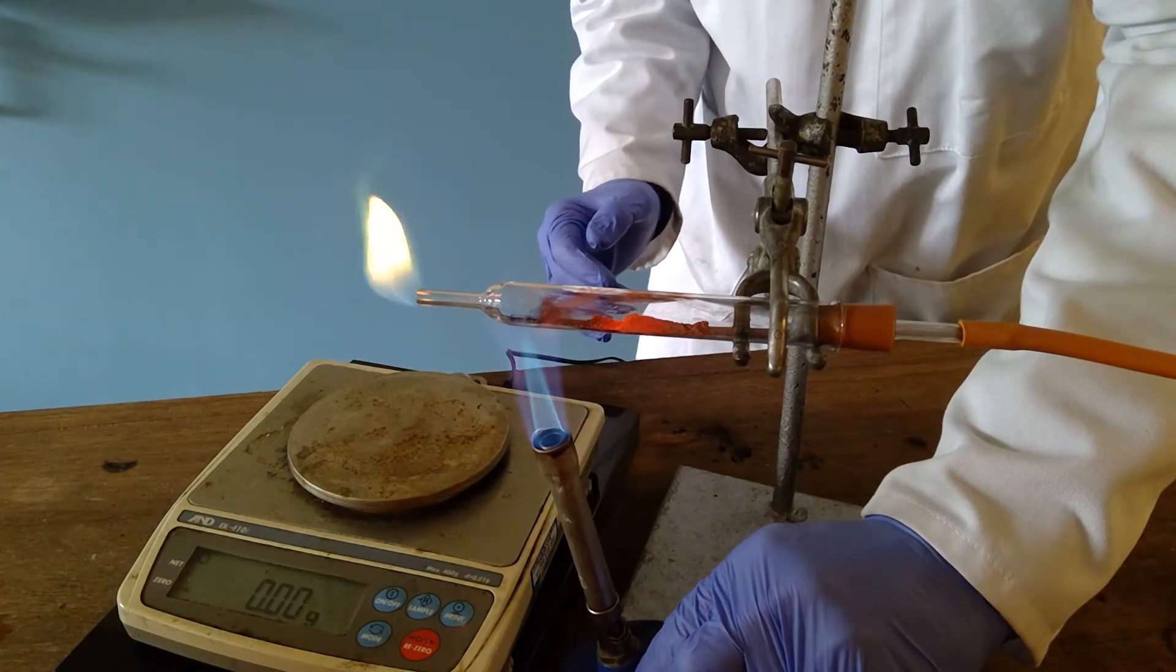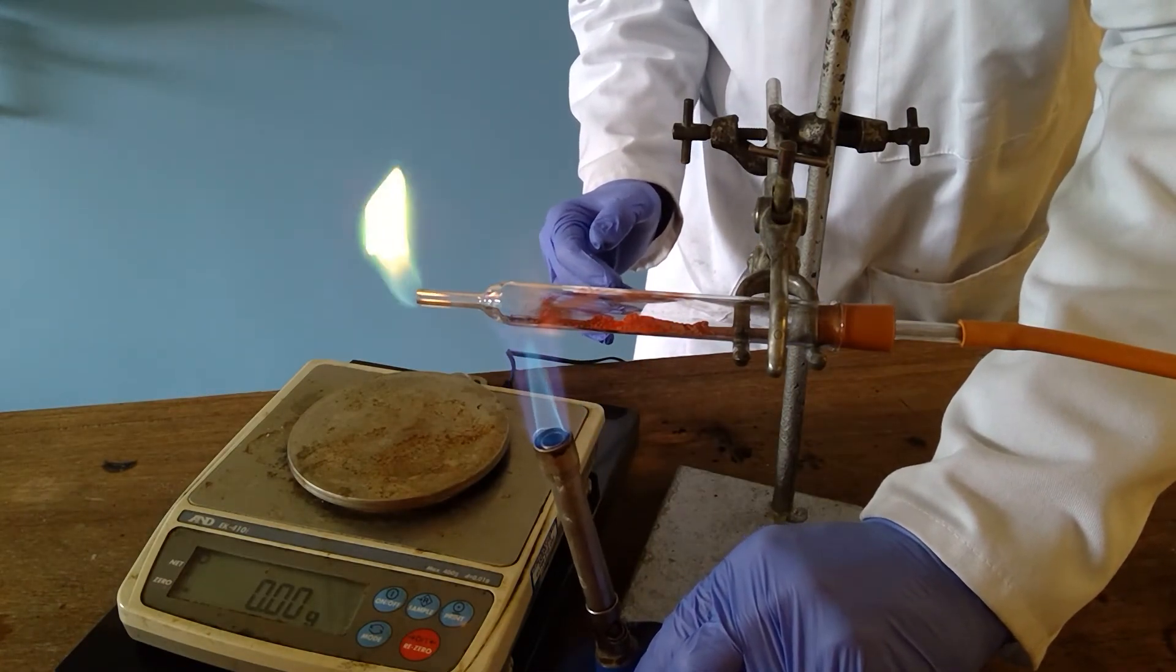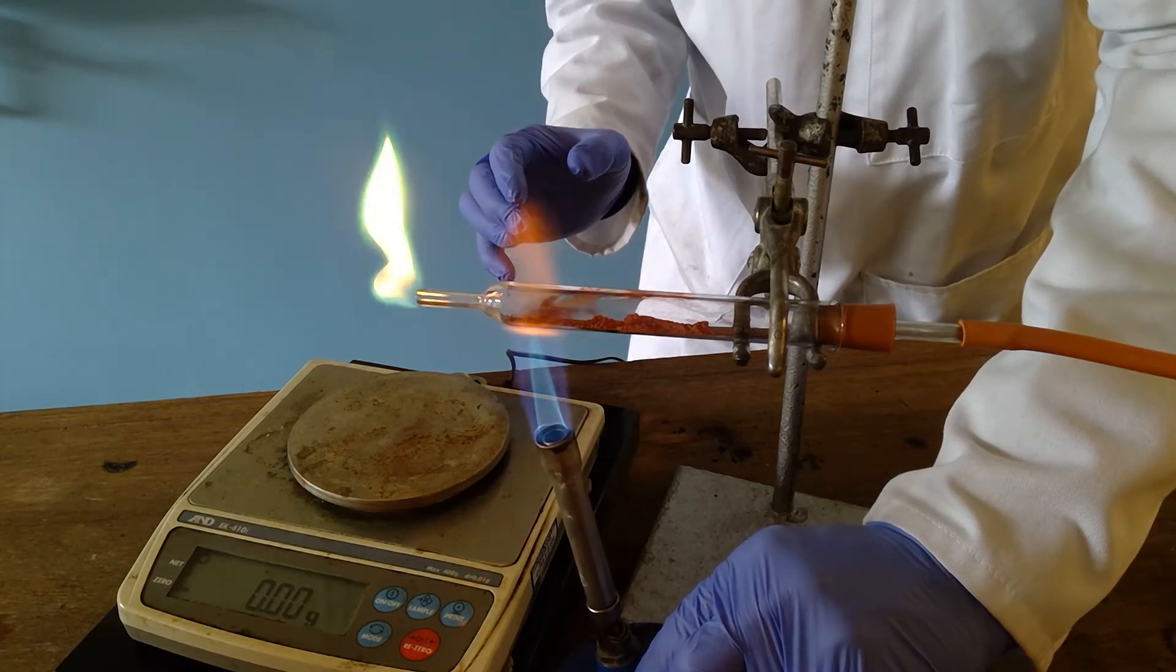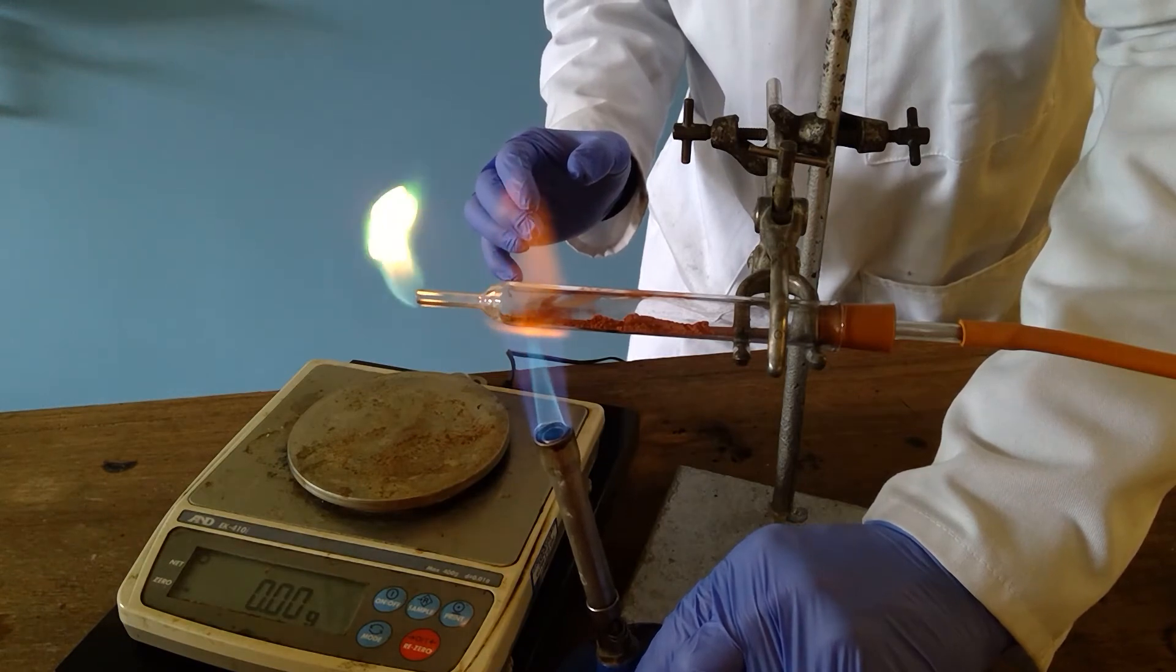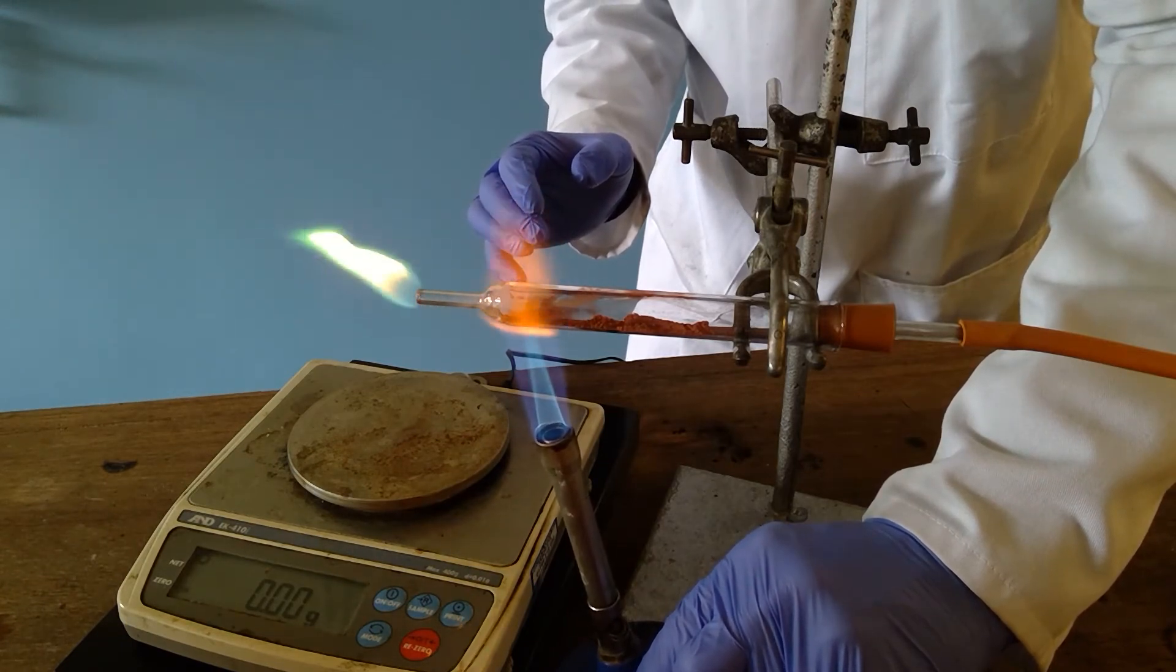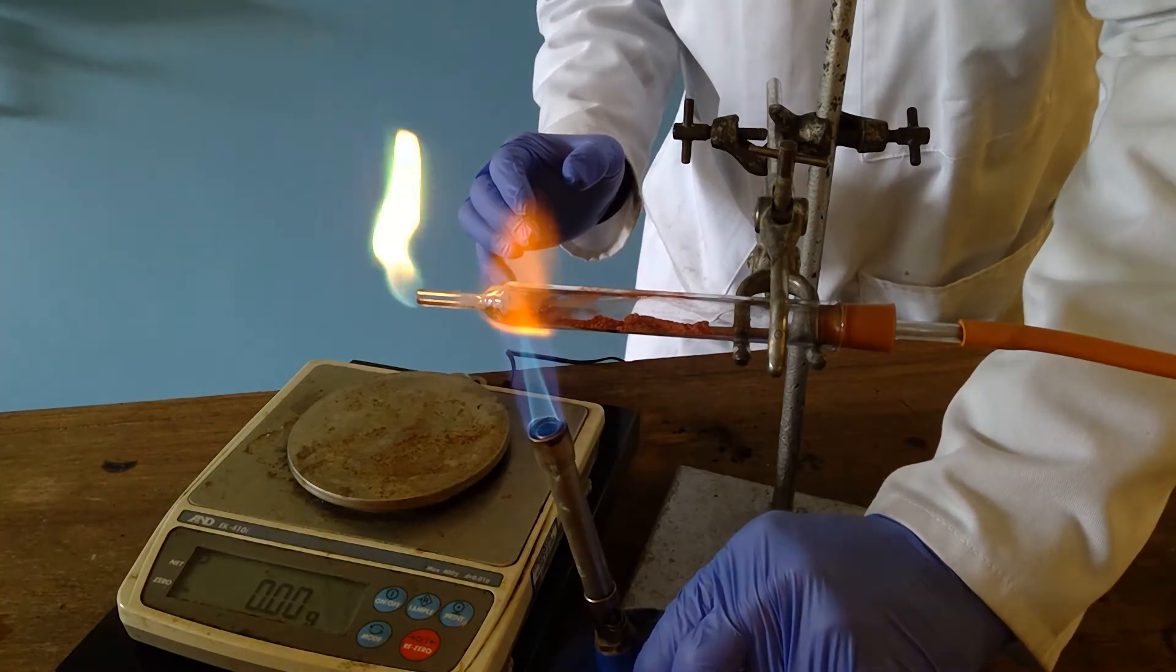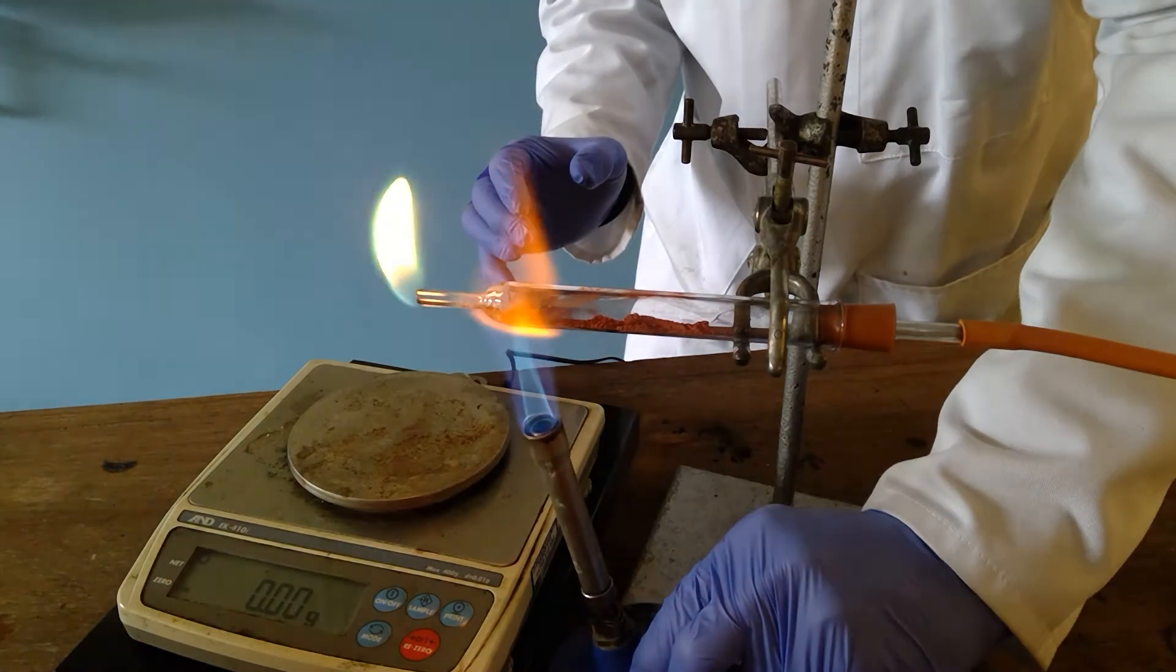You see that there is a little bit of black copper oxide at this end of the tube and you may see the flame go slightly green as there is an inevitable loss there as a result of the copper atoms being picked up by the gas and you get the typical flame colour of copper of being that blue green colour.